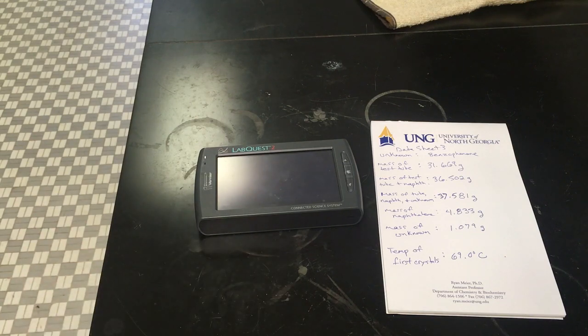So that's the general waste disposal. Nothing from this experiment goes down the sink. Naphthalene, benzophenone, biphenyl, all three of those compounds that we use are organic-based compounds that are pretty bad for the environment, so we can't just rinse stuff down the sink. All of it does get specifically collected for our waste.